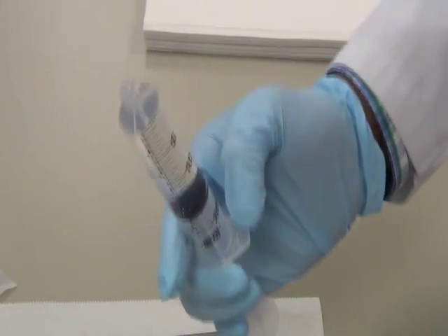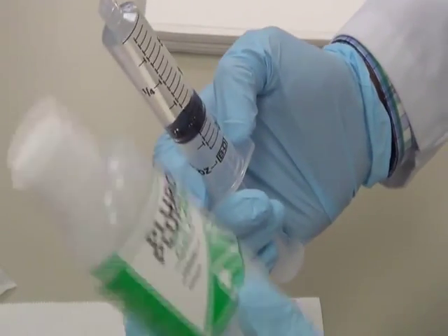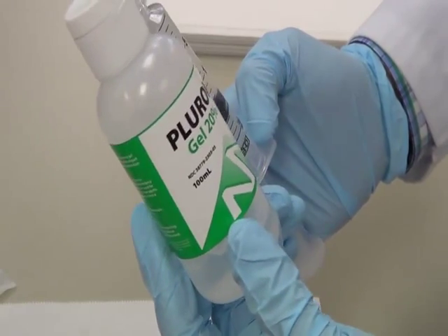In the second syringe what I did is I filled this with 14.5 ml of Pluronic. So this is Pluronic. I got it from the refrigerator.